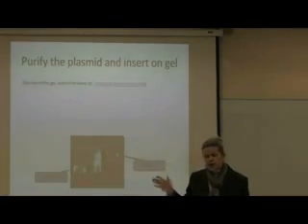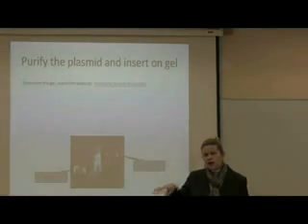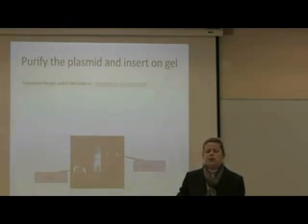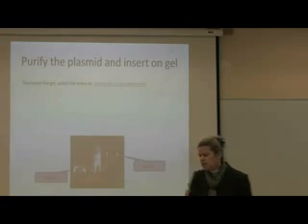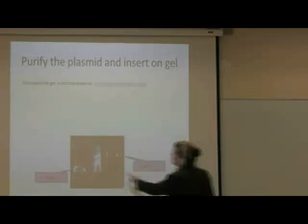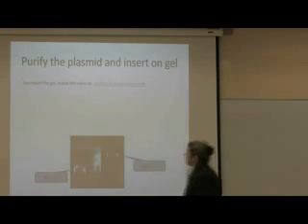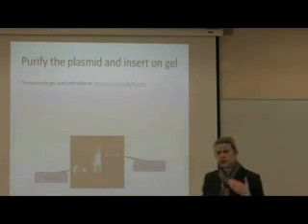Okay, if you watch the video, you'll see that I tell you to stir it and boil it, and then stir it, bring it to a boil. You got to do that 4 times and keep stirring it, because if you don't do that, this is what happens. If you have chunks of undissolved agarose in there, and it doesn't run neatly.